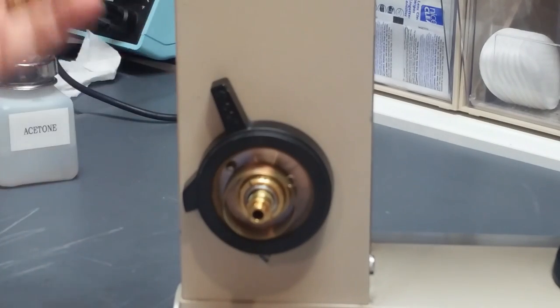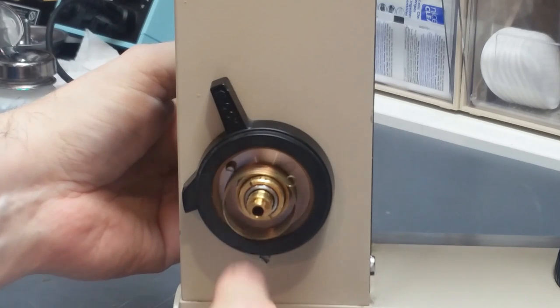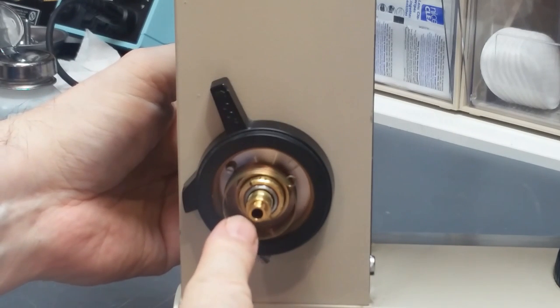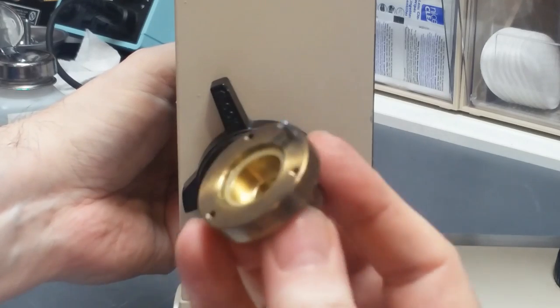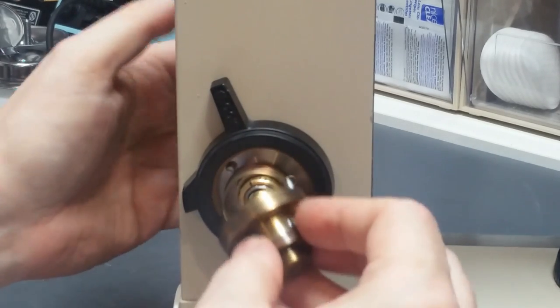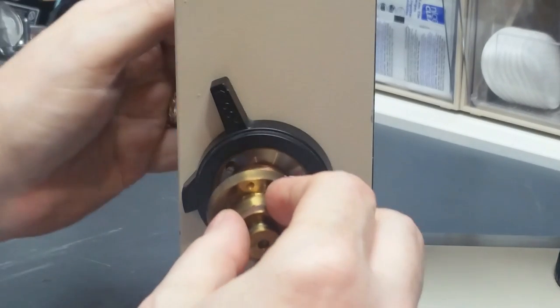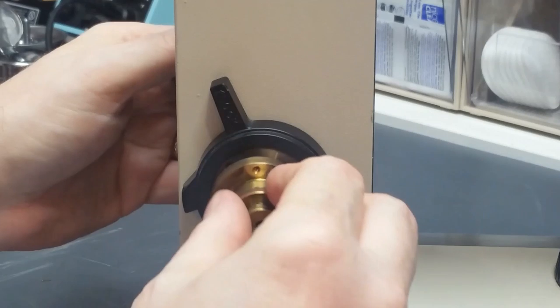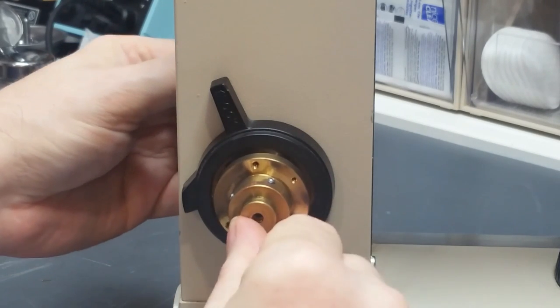I'm going to show you this before I unscrew it with this piece. Once I do that, I'm going to reach around back and grab the coarse knob on the other side, and pull it back until this shaft, which is protruding, goes back into there and doesn't interfere with this. Okay, but to start with, I'll just leave it out. And now put the pin over the spring, in the loop of the spring.